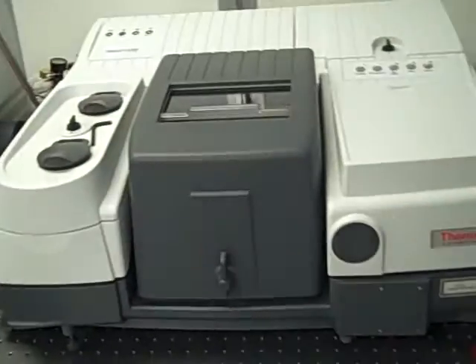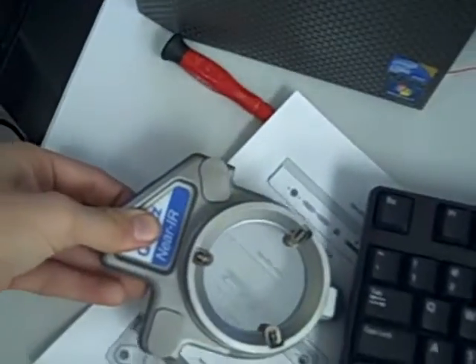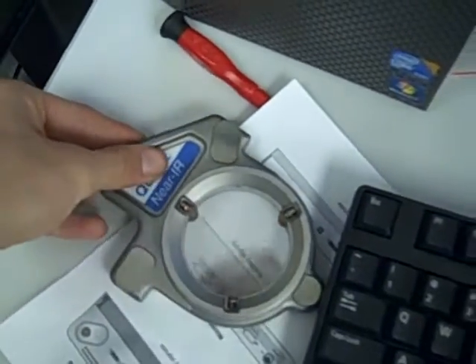Then you go to your machine over here and go to the hatch where all the beam splitters are located. You open it up, and you turn this knob so it releases the clamp on your beam splitter. You set it down slowly.